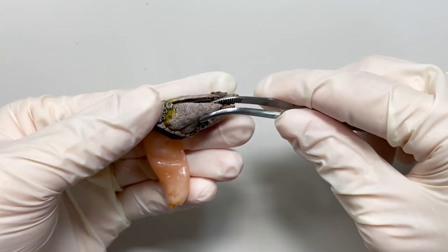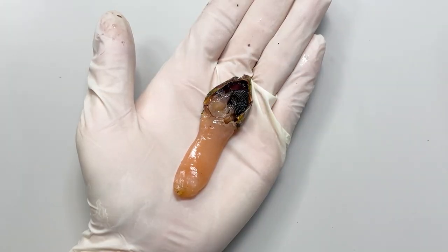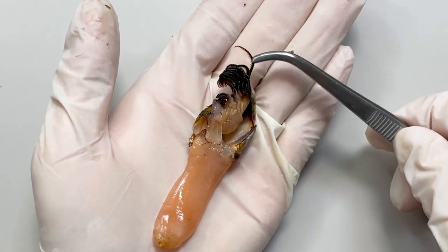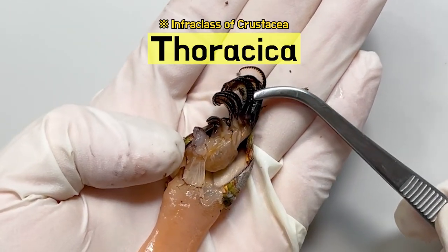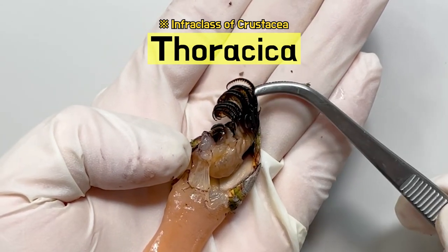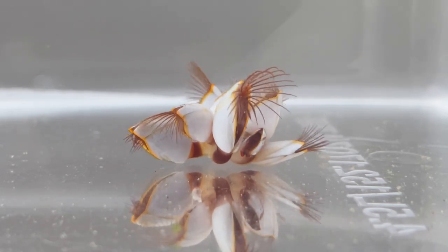I removed the calcareous plate from the top of the capitulum. Then you can find a vine-like area inside. This is called thoracic legs. The gooseneck barnacle belongs to Thoracica, an infraclass of Crustacea. Most Thoracica hunt prey by sticking out their thoracic legs.